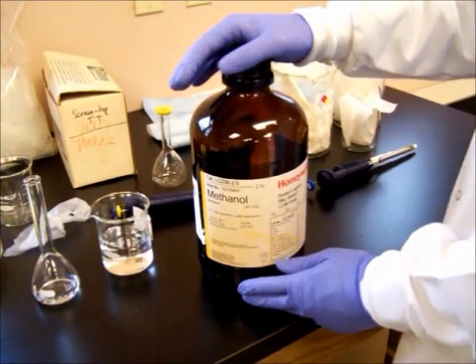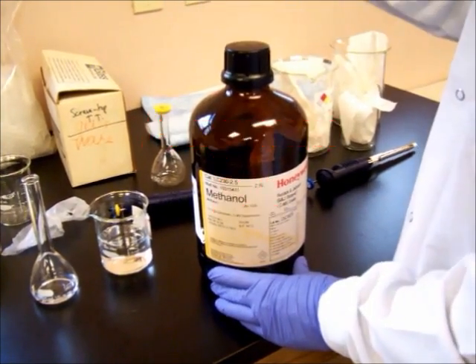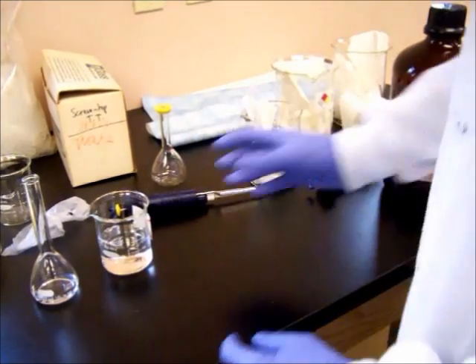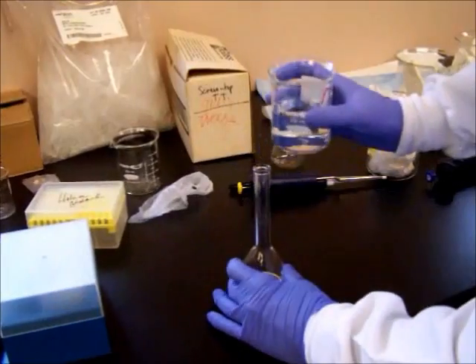If you're running low in methanol, make sure you're telling your PI that you need more methanol. So simply enough, we're going to transfer it.